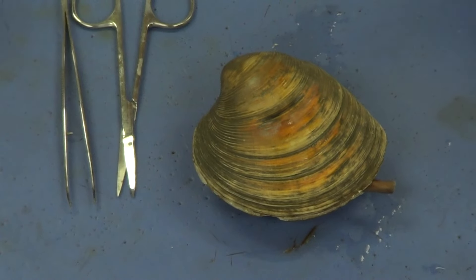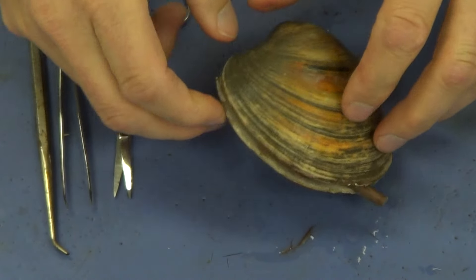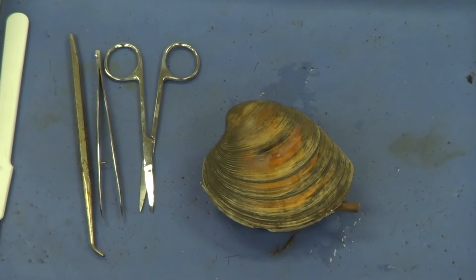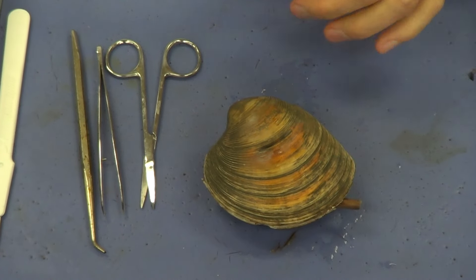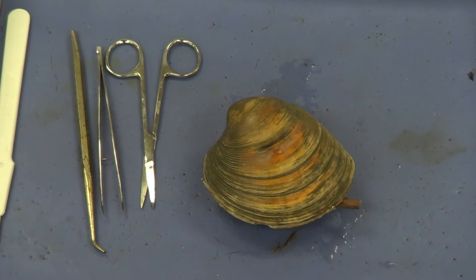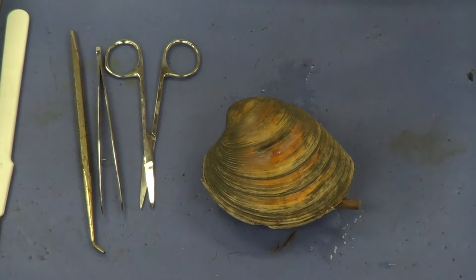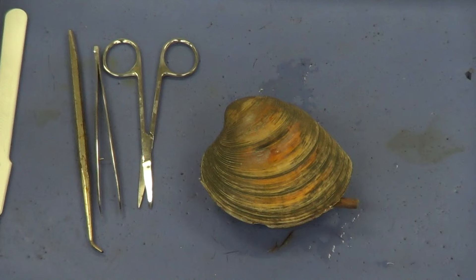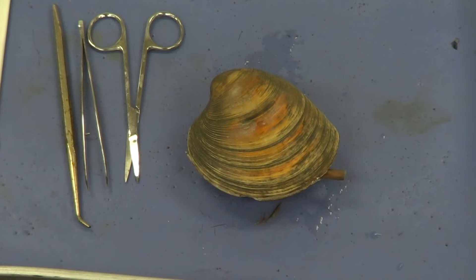The first thing we need to do in dissecting is to open up this mussel, but that is difficult. There are two very strong muscles holding these two valves or shells closed. In order to get at the inside, we have to cut those two muscles. Those muscles are called adductor muscles. When they close the shells, the muscle is bringing the two shells closer together — so they are referred to as adductor muscles.